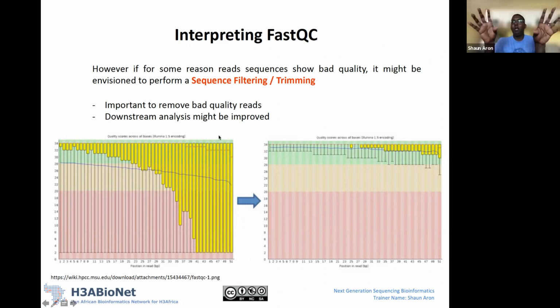And one of the major metrics that are used for the quality of your data is the quality score. So going back to the first graph that we had a look at. For example, in this one, you'll see that we have quite strange data going on here. This is looking at quality scores. This is the box and whiskers plot. And what you'll see is that for the whole data set, we have quality scores at each position ranging from 2 all the way to 34.